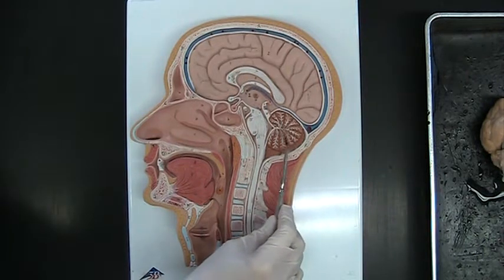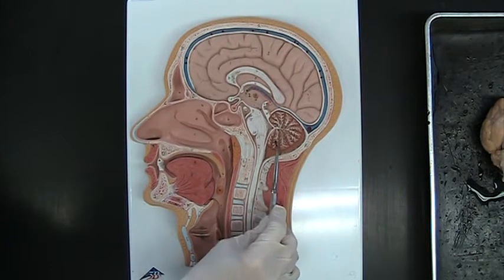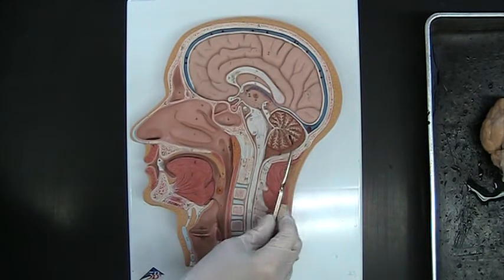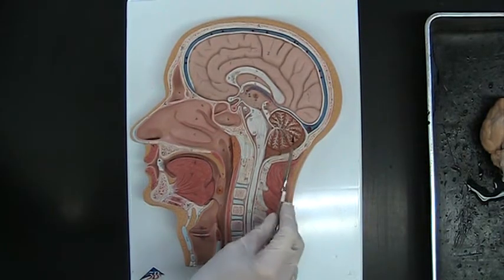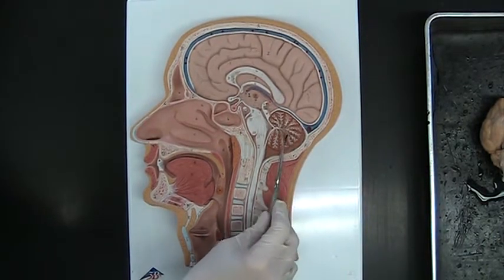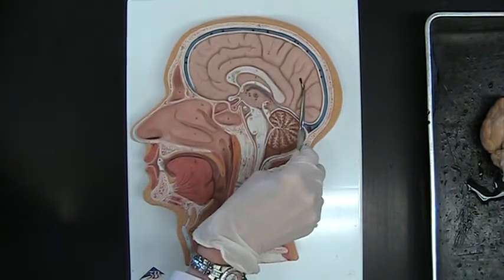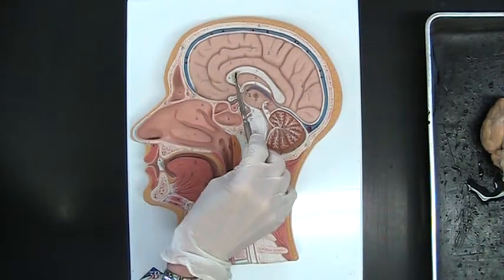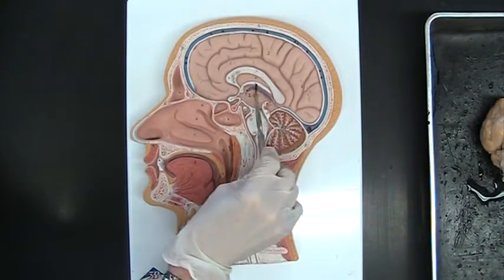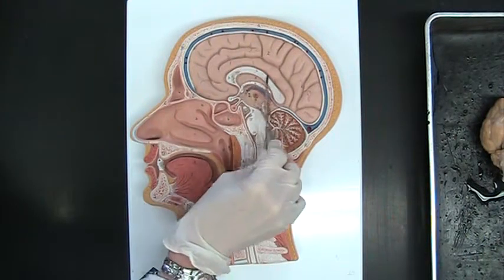The cerebellum is sometimes called the hindbrain, low and in the back. And part of the cerebellum, you can see the white nerves, those would be myelinated nerves in there. They call that the arbor vitae, or tree of life. And so the arbor vitae is in the cerebellum. And then the cerebrum, when we dissect it in half, the first thing that you're going to see is the sheet of connective tissue that holds the two hemispheres together. That's called the corpus callosum.